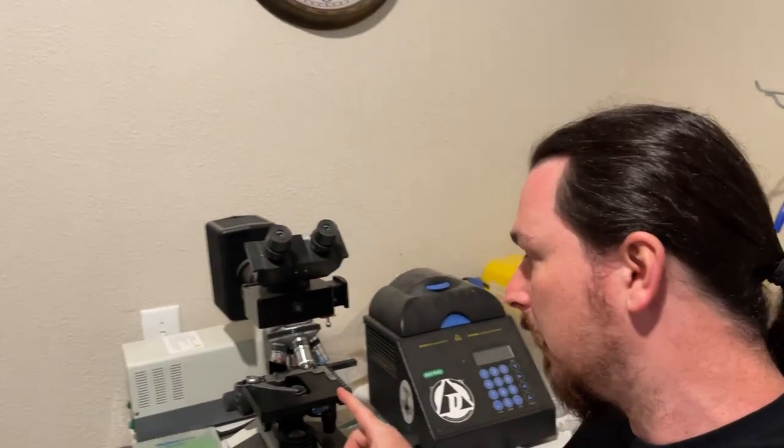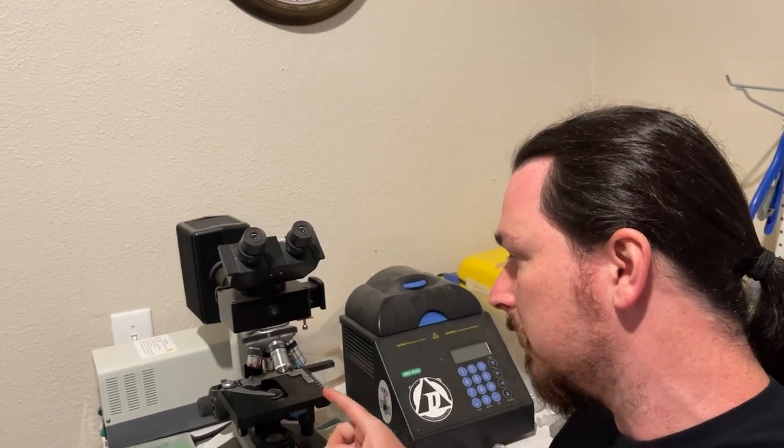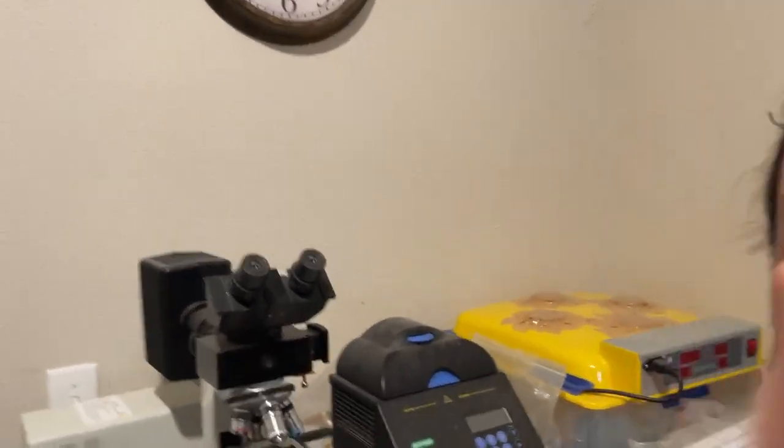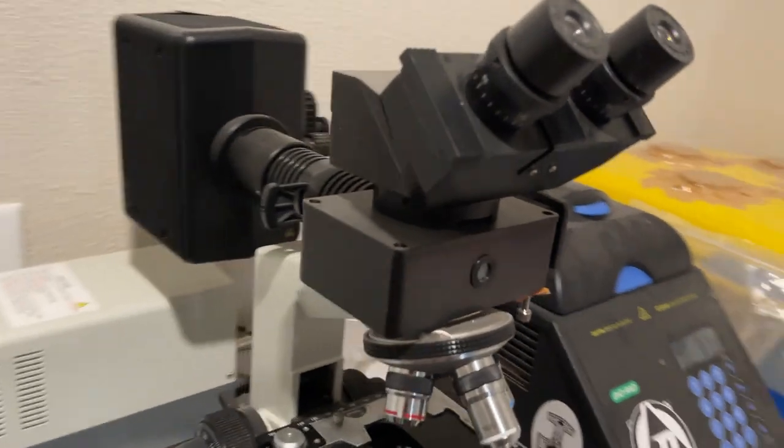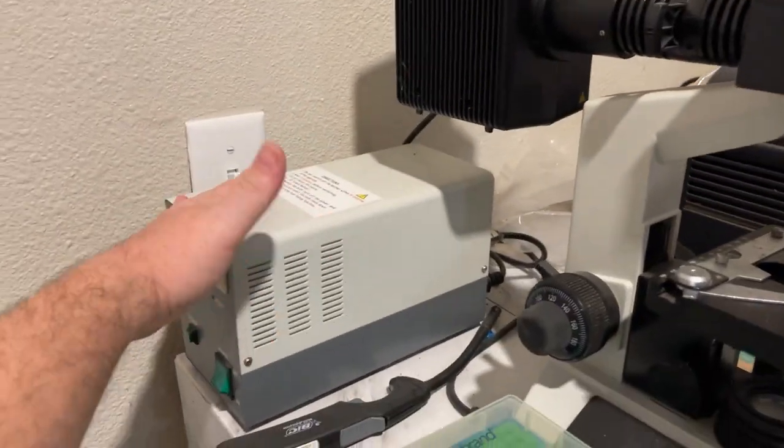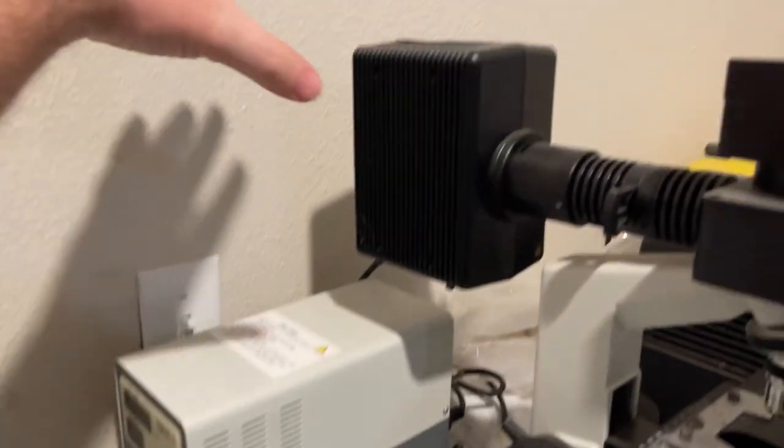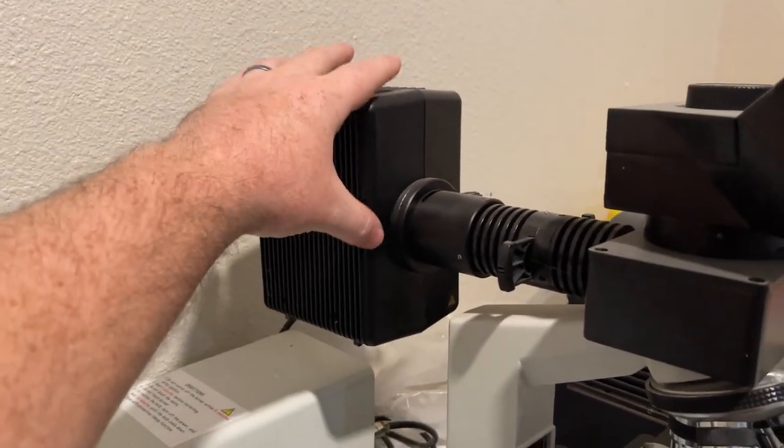My original plan was to use my fluorescent microscope to do that. The fluorescent microscope is really nice, has a lot of interesting features. This is its power supply. The bulb is actually here. It's a UV bulb.